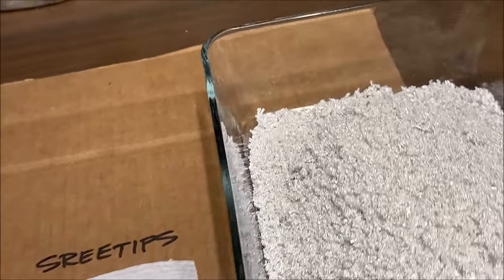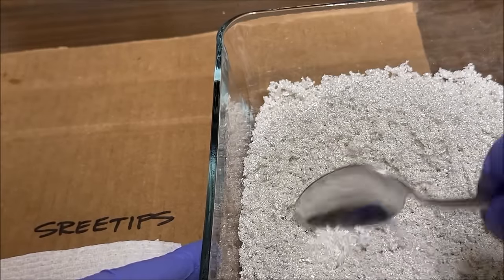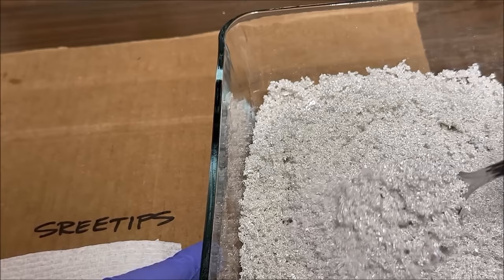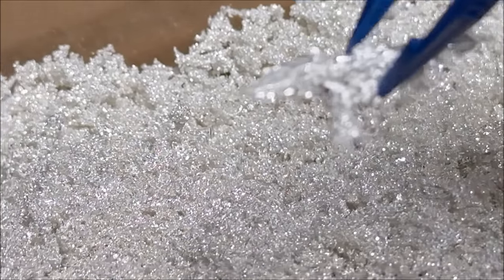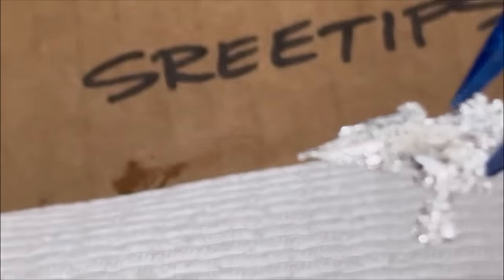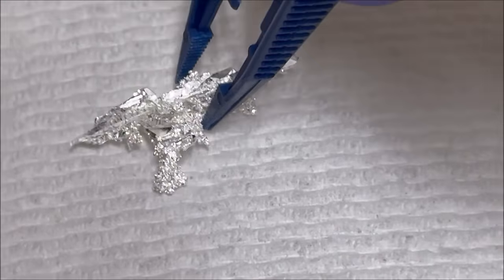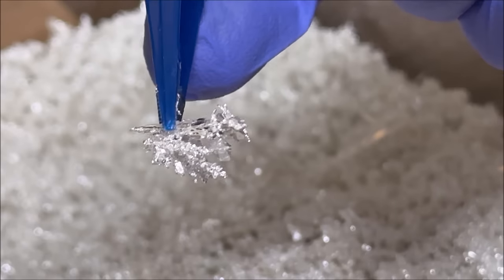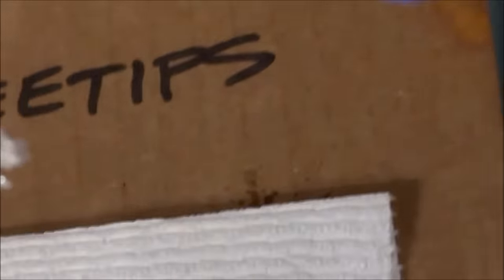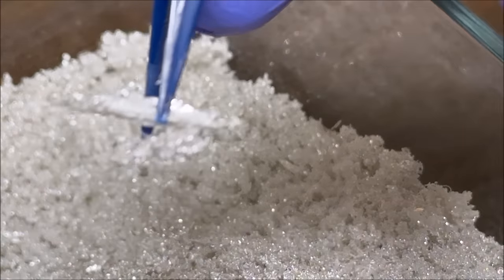But what we're going to do now is dig through this pure silver here and see if we find some of those extra large crystals that we had growing in there. Nice big chunky crystal from the silver cell. Look at that thing, man. Wow. I'll set that on paper down here. Nice big fat crystal there, unusual shape. Set him over here. A couple more down in the silver. There's a beauty.